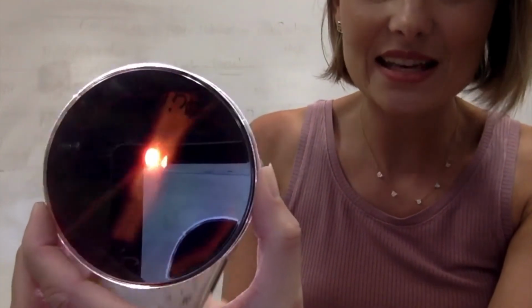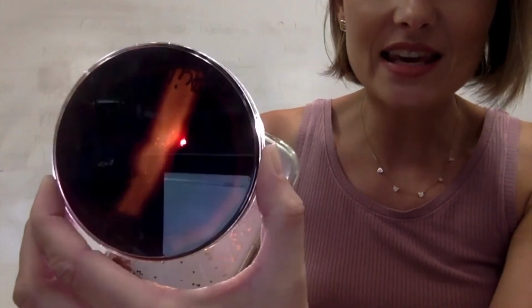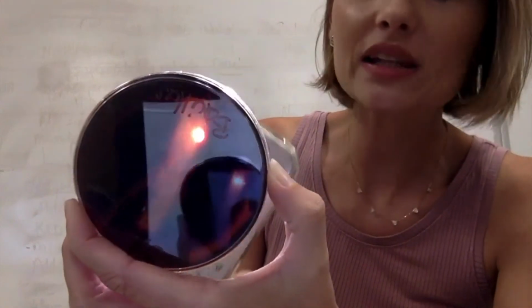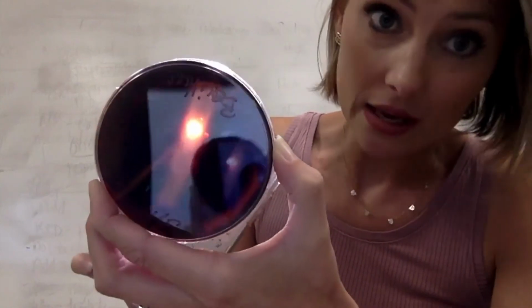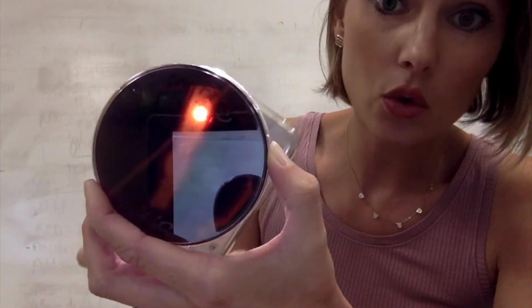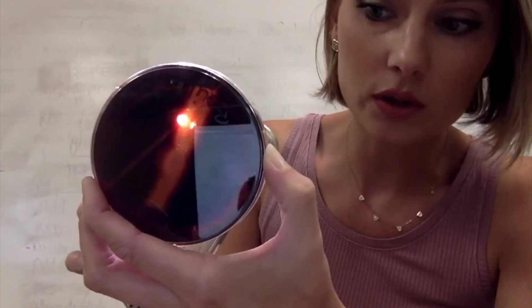It ate the starch. Now, like I said, these have been in the incubator just barely 24 hours. If I were to leave this out even longer, the Bacillus would have more time and would eventually eat pretty much all of the starch in the plate. But you're seeing that halo around the colonies, and that's what we are looking for.